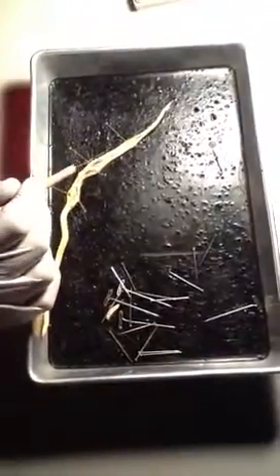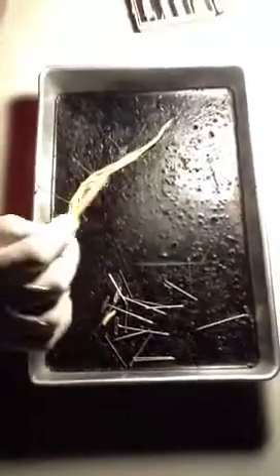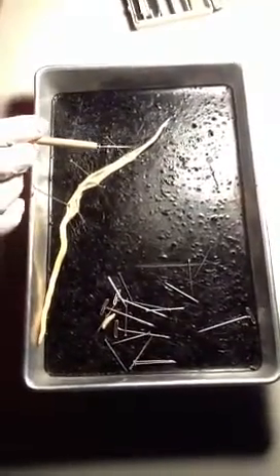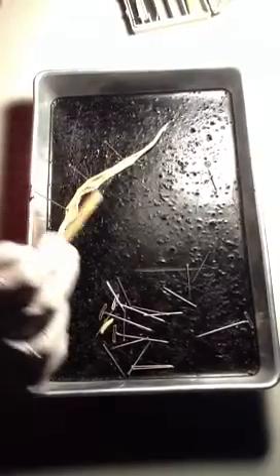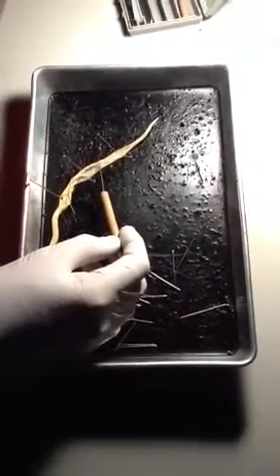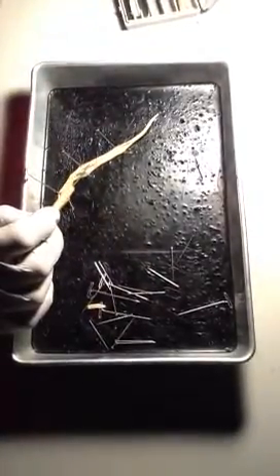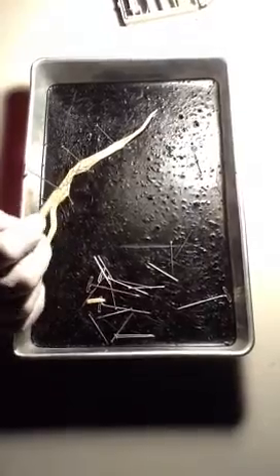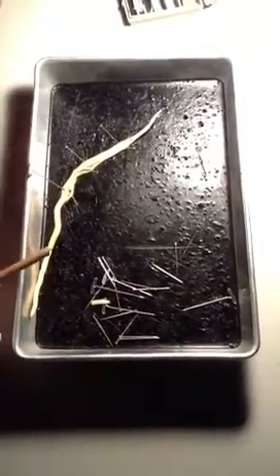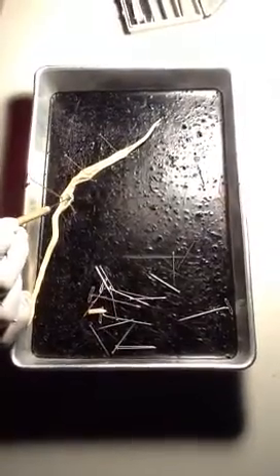So what do we have? I did a pretty good job. We have this little flat ribbon here — that's the intestine. As I pick up this big thing here at the very end, notice I started about an inch down from the head, then about another inch below that. I get the thick stuff, and at the very end of that thick stuff it comes down to a really thin thing — that's the vagina. Then it goes up into the uterus — the thick stuff is the uterus. And then you get this thin little spaghetti, angel-hair looking stuff — that's the ovaries and the oviducts. You can't tell the difference without a microscope. The uterus is thick; the ovaries and oviducts are real thin.